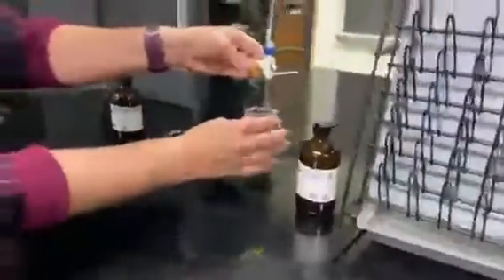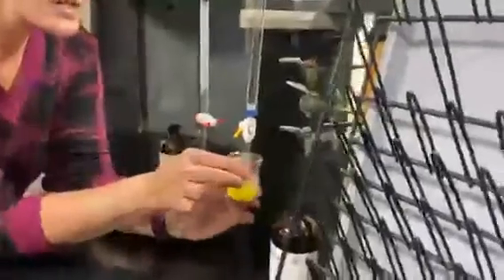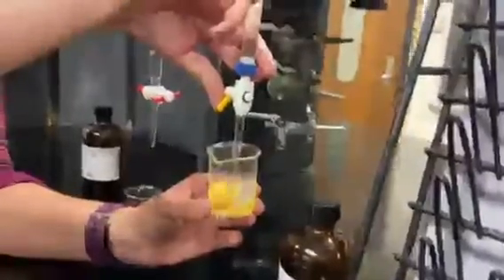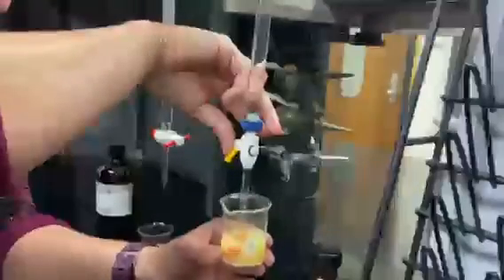Now to solution B, I'm going to do the same thing. I'm going to add it drop-wise into the beaker. Oh, gotta get drop-wise going. You see it initially makes a solid. And then, again, it's already starting to show that, okay, that beautiful red, but it's not staying. Okay, it swirls away. Swirls away, oops. Swirls away. Don't swirl too much. Lost a couple drops, so.